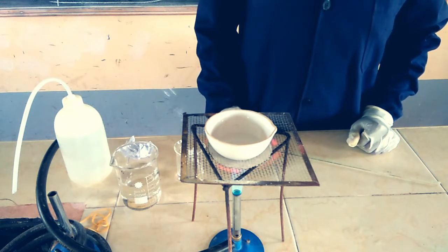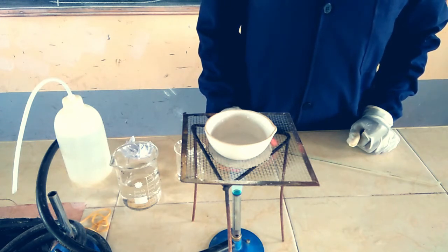Remember to use a non-luminous flame, as we said in our previous videos. Non-luminous flame is very hot and does not produce soot. We are heating our solution to drive out the excess water through evaporation.